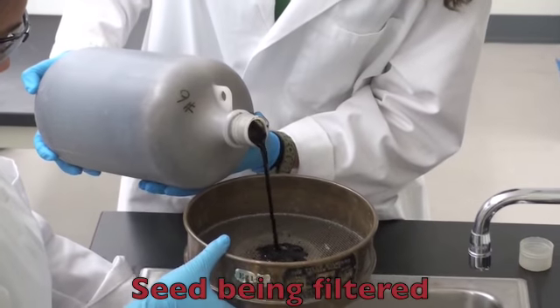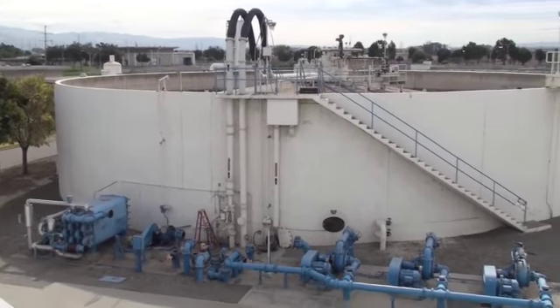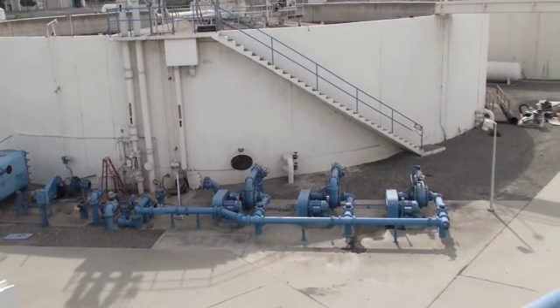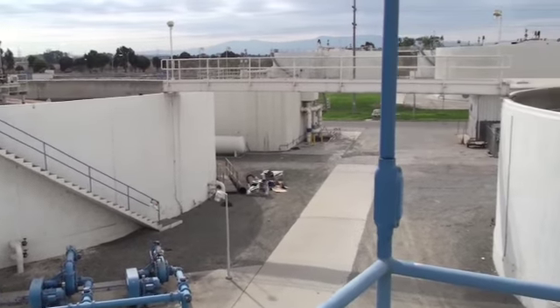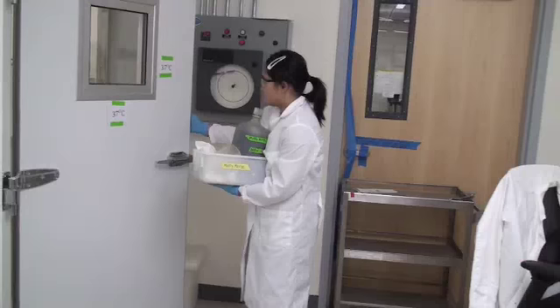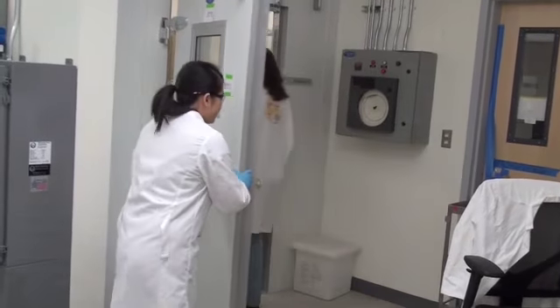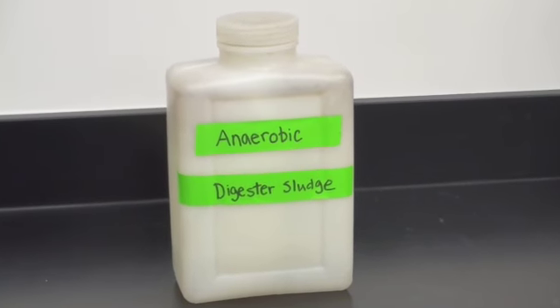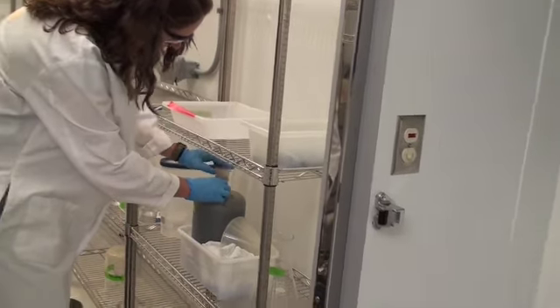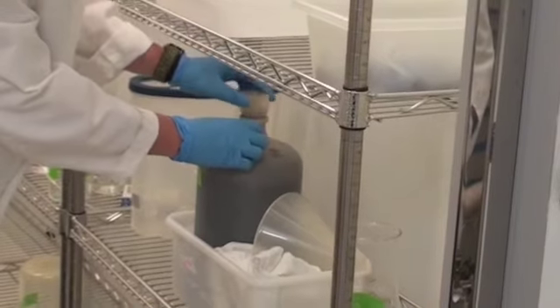We obtained anaerobic biosolids from a digester at a local wastewater treatment plant for our seed material. However, there are many different seed materials you may use, including anaerobic sediments and landfill cores. When storing the seed material, it is very important to use a plastic jug and to keep the cap slightly ajar. This allows proper venting and has no adverse effect on methanogenic activity.